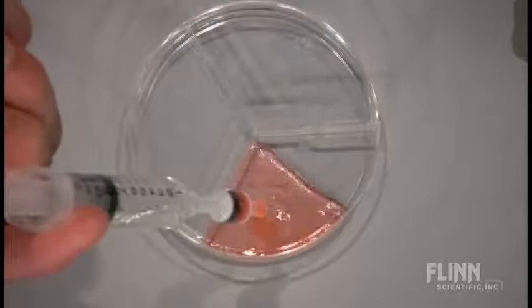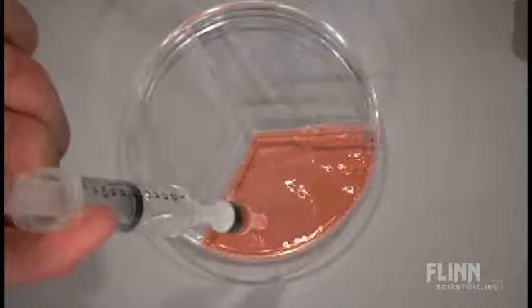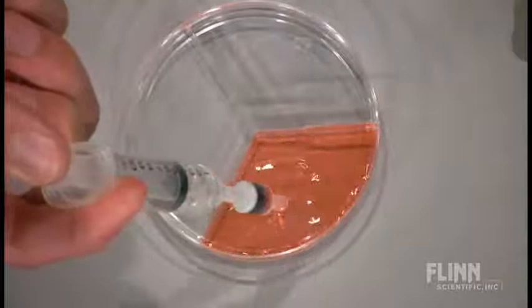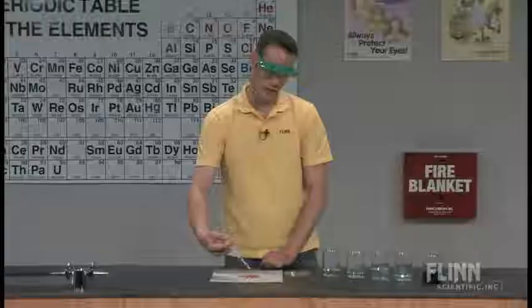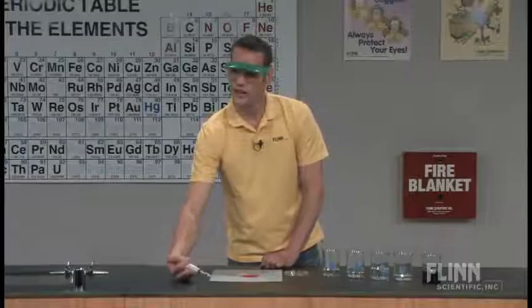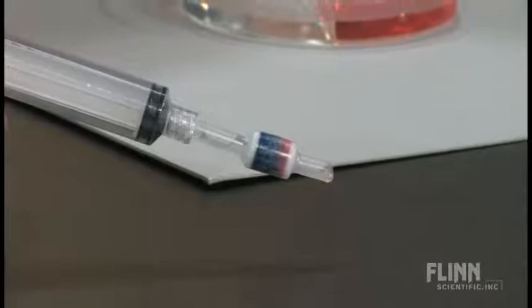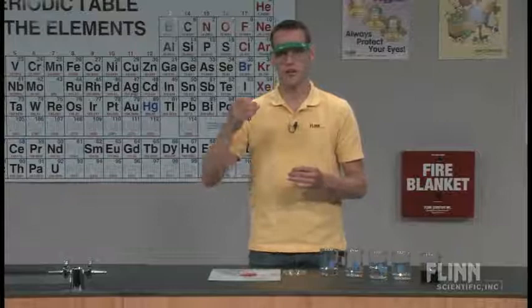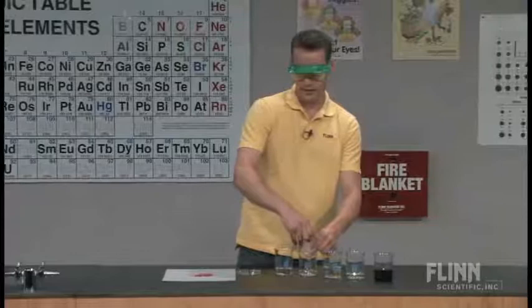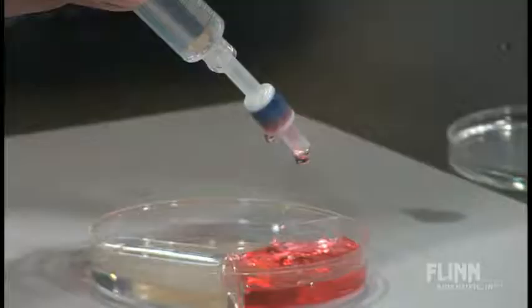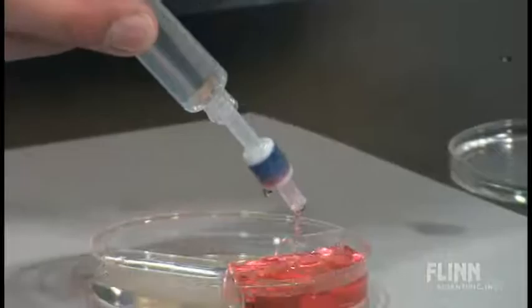Some of my students will sometimes call this color pink rather than red. I do have to remind them that pink is just light red. But after they push through the red dye, they can still see that there's still some blue left in the cartridge. One thing that you do if you make it more concentrated than less, you have to sometimes do a second or third wash. I tell my kids, keep pushing through the 5% isopropyl alcohol until all of the red goes away. I'm just going to push this through one more time to hopefully get out all of the red dye. Keep going until you don't see red anymore.